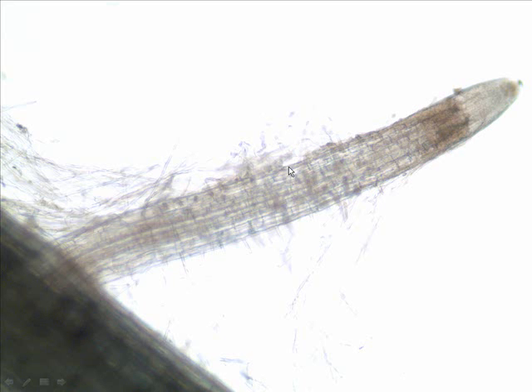All right, but then we come to a branch root. It has its own root hairs. Here's the main root down to the bottom left, and here's the branch root coming up here. And what is this structure at the end of the branch root? It would be what? The root cap. That's right. And behind the root cap would be a region here.